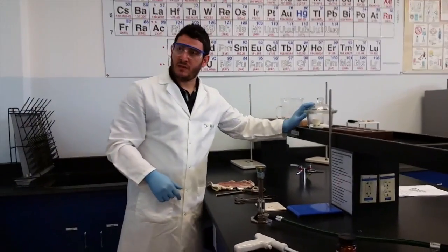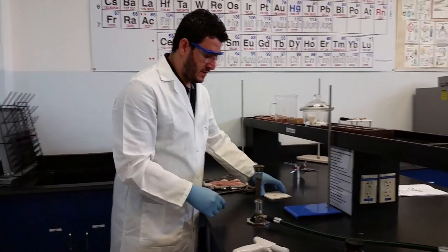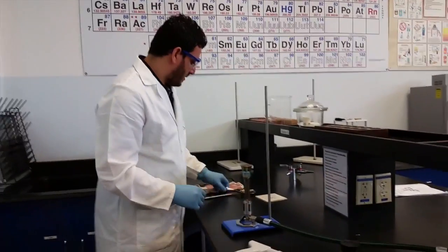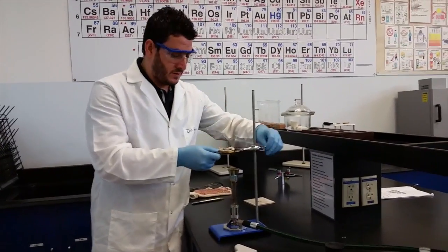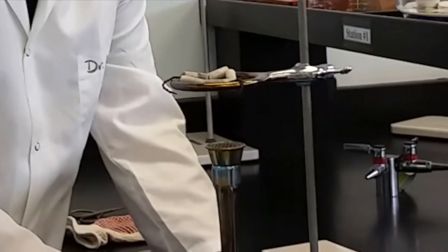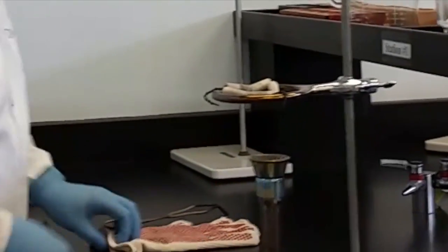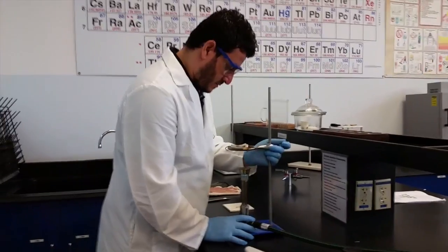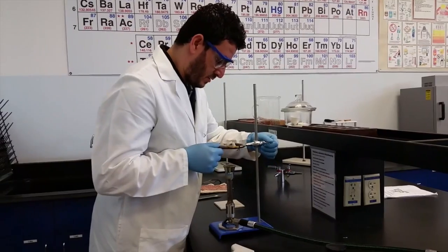Meanwhile, we'll give it some time for the crucible to cool down and we will set up our experimental setup. It's very simple - you will take your triangle clay with the ring and set it somewhere like five to ten centimeters height and centered for the burner.